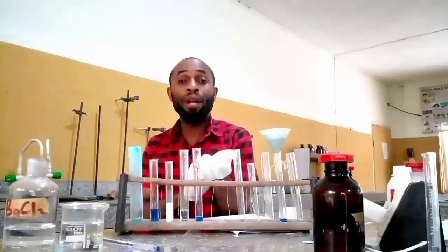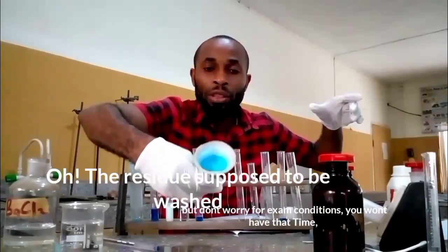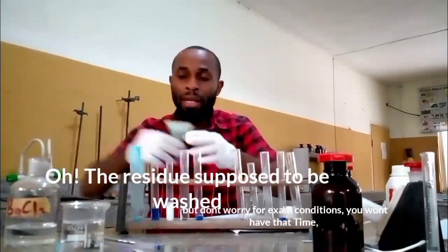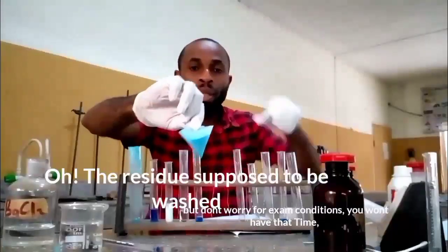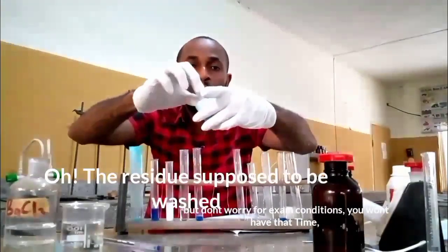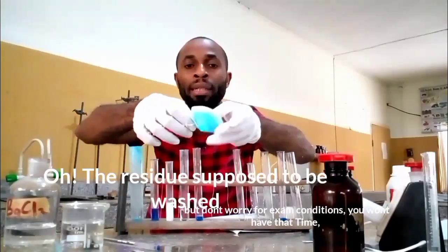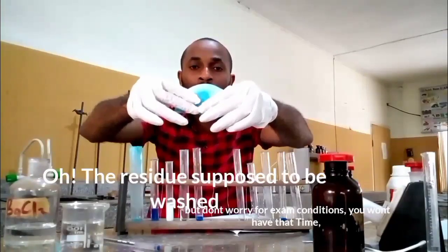Okay, now let's go for, okay, very close. This is the residue. You see the color, pale blue, more like this. Okay, now we go, you bring it out, you try to bring it down to that 180 degree. Okay.